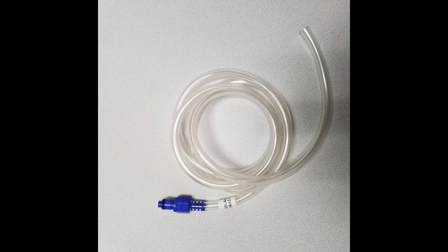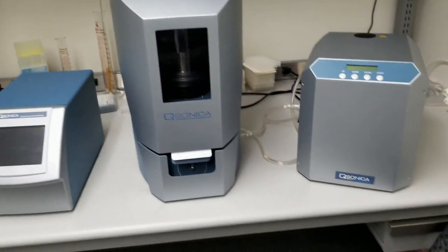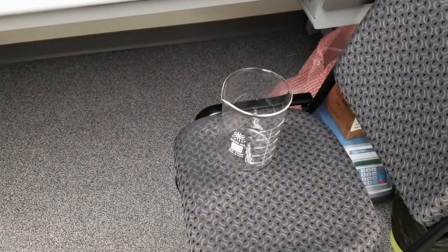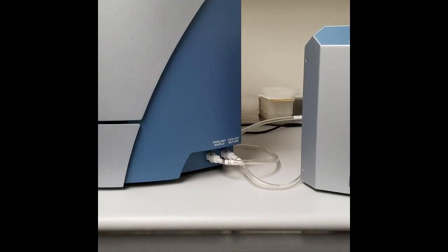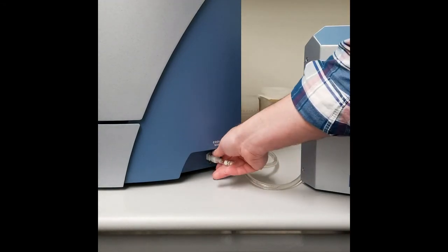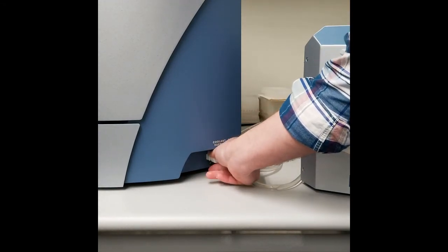Place the container below the sound enclosure so that water will drain once the valves are opened. On the right side of the enclosure, there are two valved ports, which are connected to two pieces of clear tubing leading to and from the chiller.